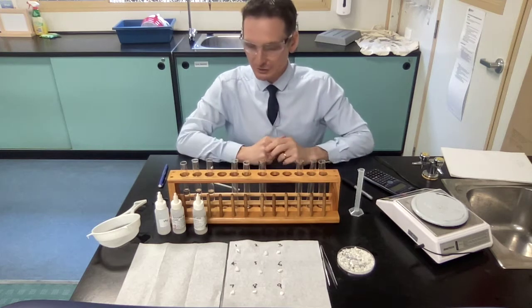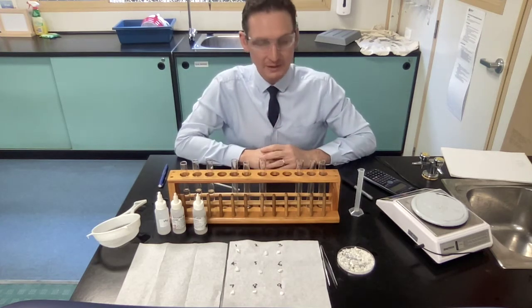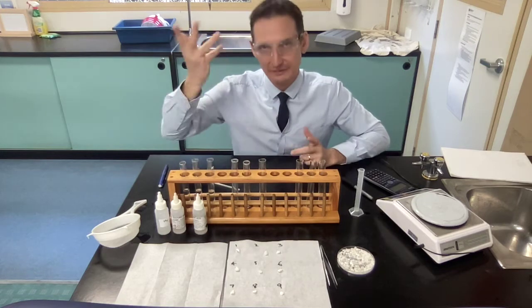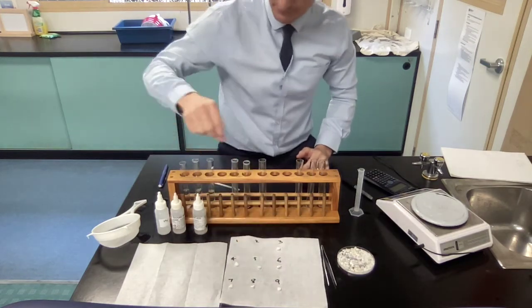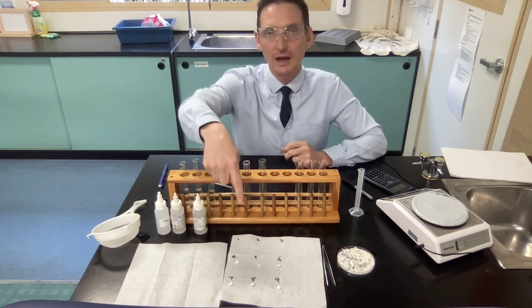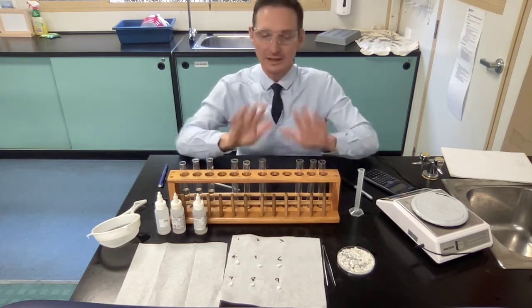So now we have our solutions, now we have our acid rain, and we have our rocks ready to go. Now we want to put them all in. You're going to put them in for 5 minutes. So I'm going to simulate that by just putting the first 3 in. So 1, 2, 3. Stopwatch has already started for 5 minutes. I will keep on going, again, demo, but I will keep on going and putting all 9 in there.